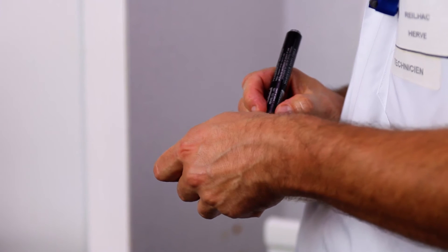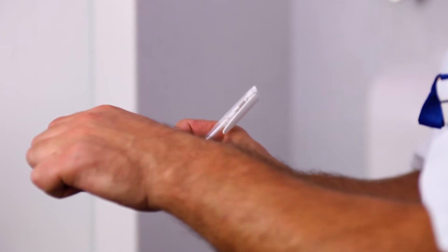Identify the bottle by using a marker pen and fill in the sampling sheet.